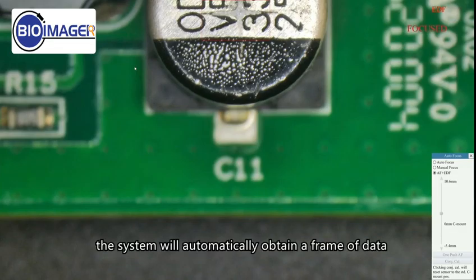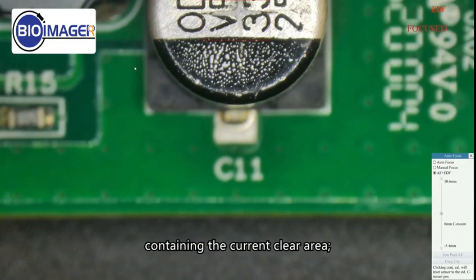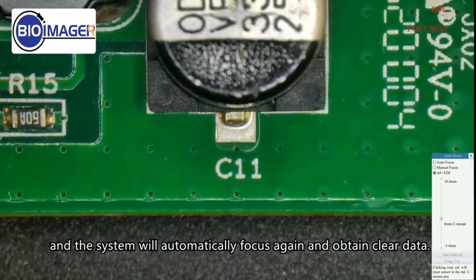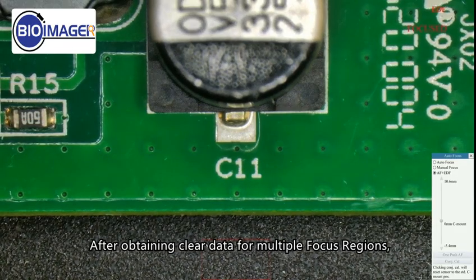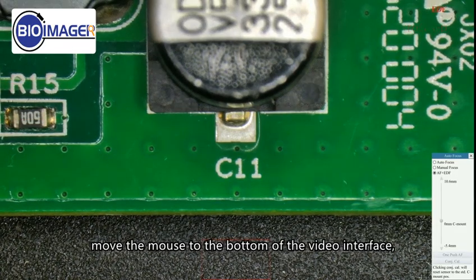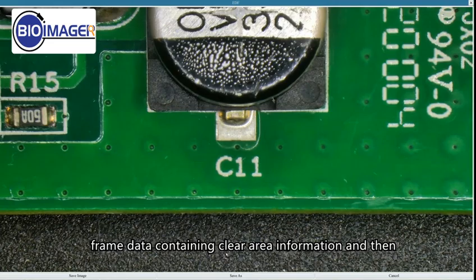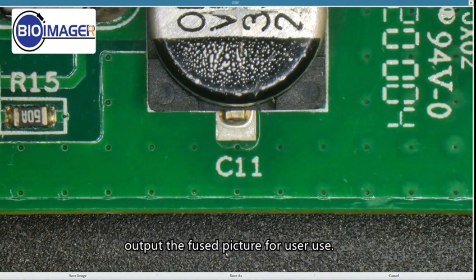The system will automatically obtain a frame of data containing the current clear area. Use the mouse to switch to different focus regions, and the system will automatically focus again and obtain clear data. After obtaining clear data for multiple focus regions, move the mouse to the bottom of the video interface. Click the OK button. The camera will perform EDF on the caught frame data containing clear area information, and then output the fused picture for user use.